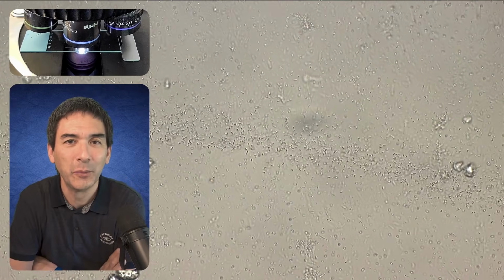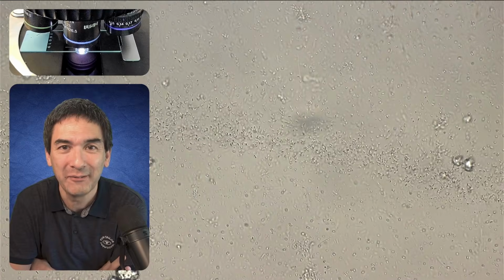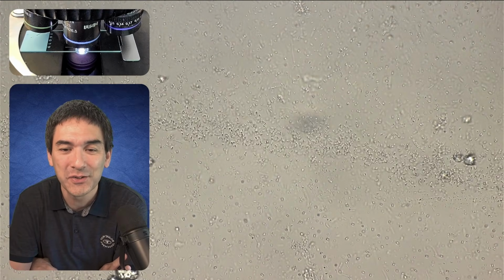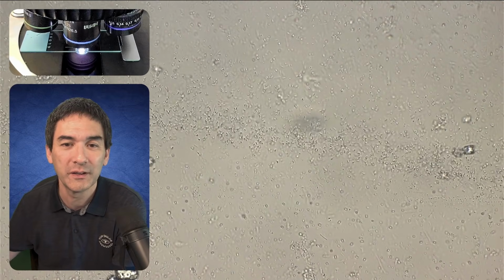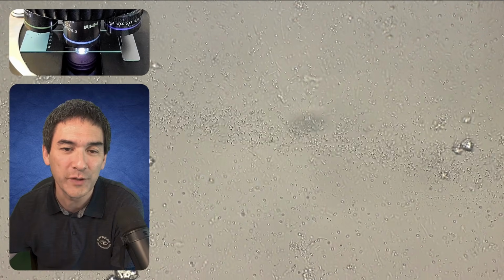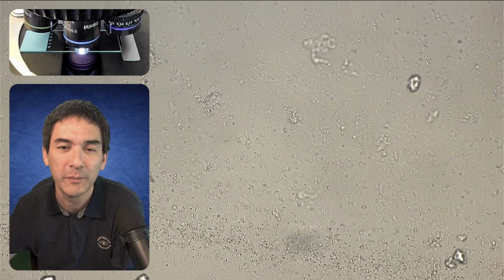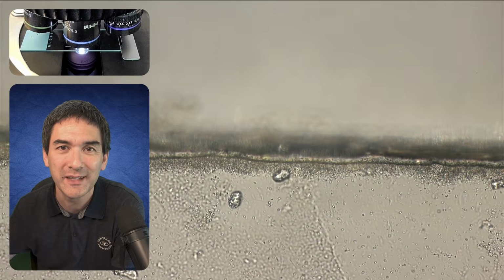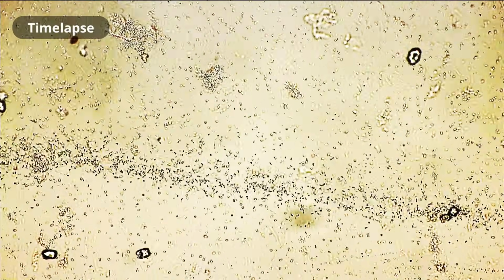Well, I did not have to wait 20 minutes or so. Already after 5 minutes, look, here we already have the bacteria moving into this aerotactic band. You can also see that they're now moving a little bit towards the top, towards an area of higher oxygen concentration. Just want to show it to you again here, that we're not so far away from the edge of the cover glass. Here it is, right? That's the edge of the cover glass. This is where the oxygen comes from, and now they're moving towards it.